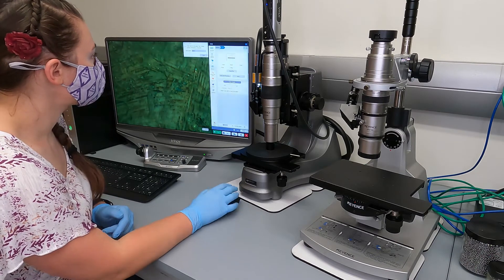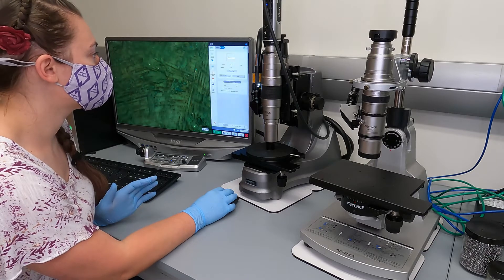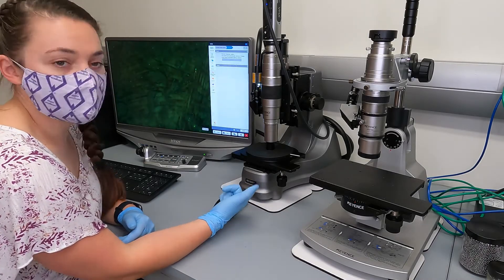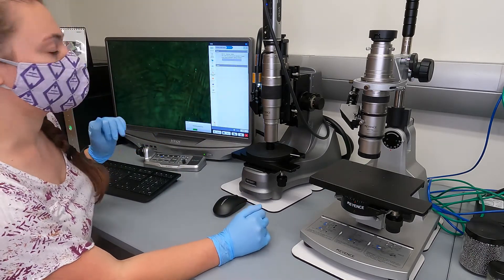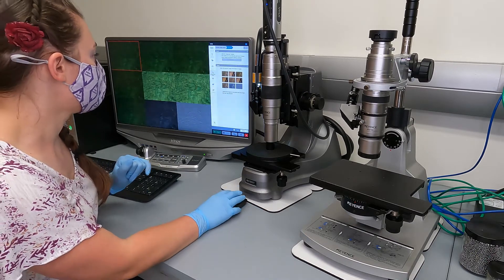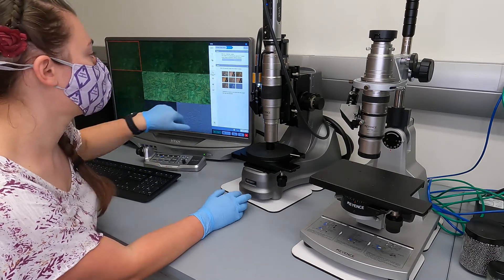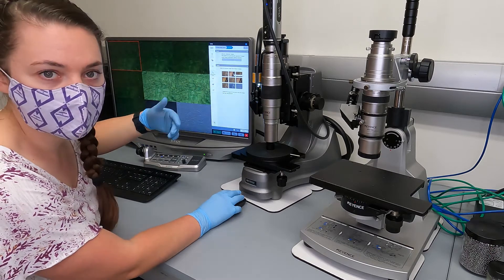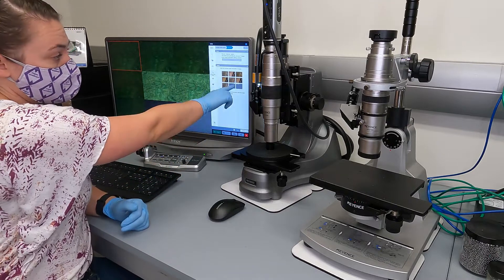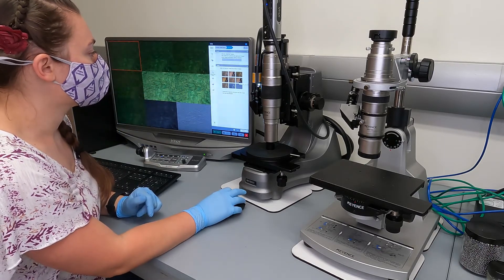Scale is also in the measure window — it'll check your magnification again, and you have the same options as in the VHX600: mesh, cross, bar, and XY bar. Important in the increased image quality window is the Optimize function. In the VHX600 we had four options, but in the VHX970 we have nine options that pop up. Hovering your mouse over each mini image shows tooltip text describing what it's doing to that image — for example, top left is normal mode, next is normal light plus light shift, etc. You just double-click on your favorite one, either in the mini images or on the screen itself.